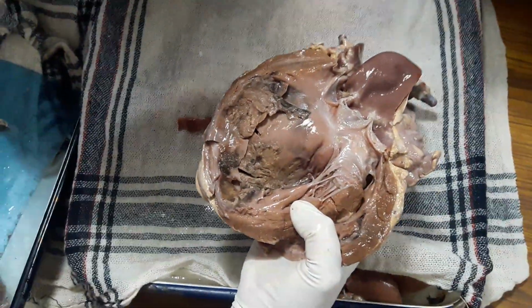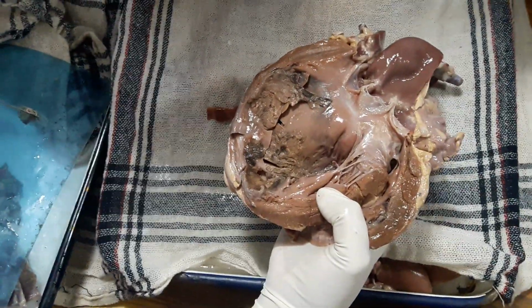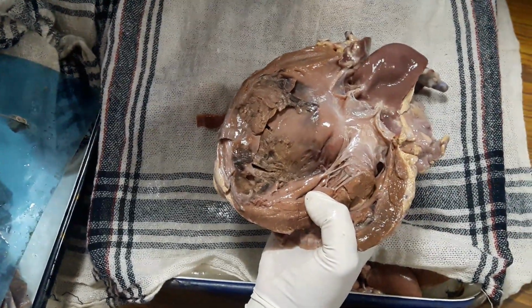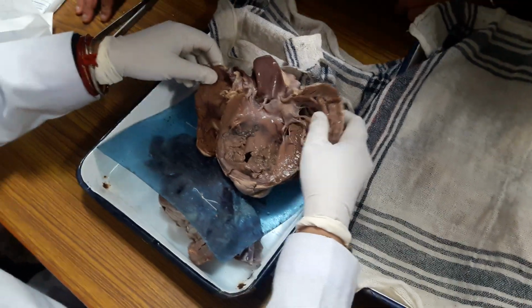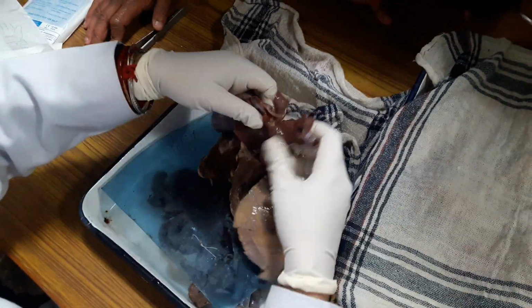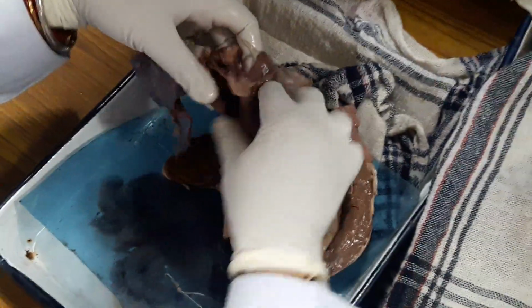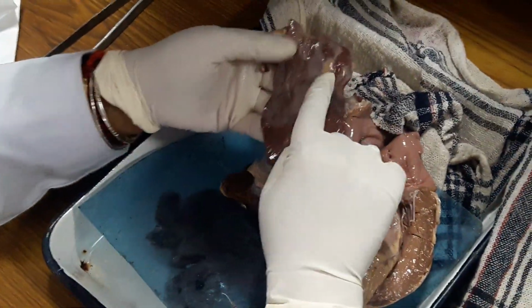And moreover, why thrombus formation? Because the necrotic segment is either dyskinetic or akinetic. If it is akinetic, there will be stasis. So stasis will result in thrombosis. Okay. So this is a complicated one. Okay, this is a complicated one, and you have to see the atherosclerosis of the coronary arteries. Aorta as such shows, see, these are raised fibrolipid plaques.